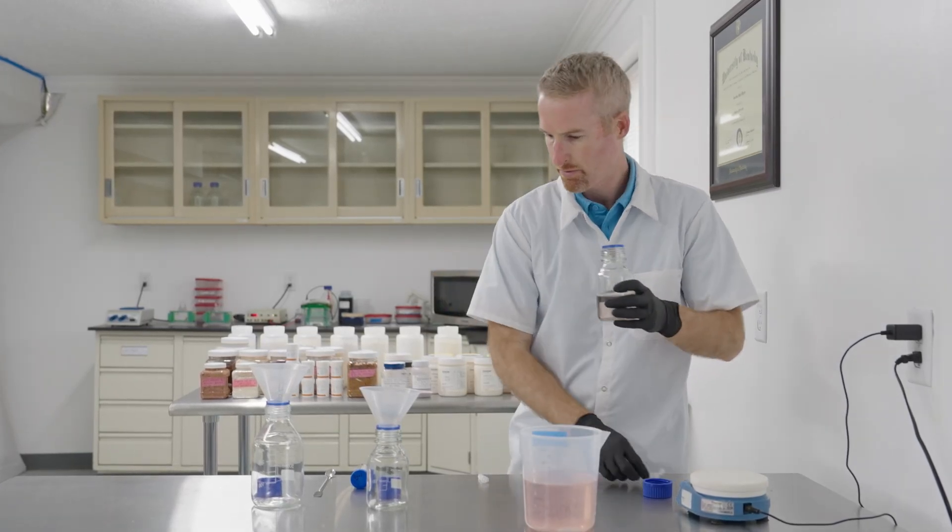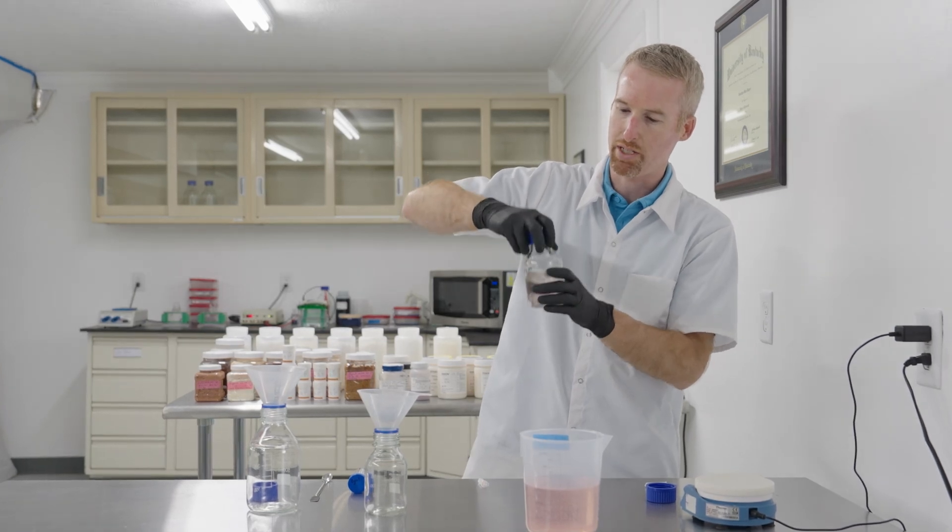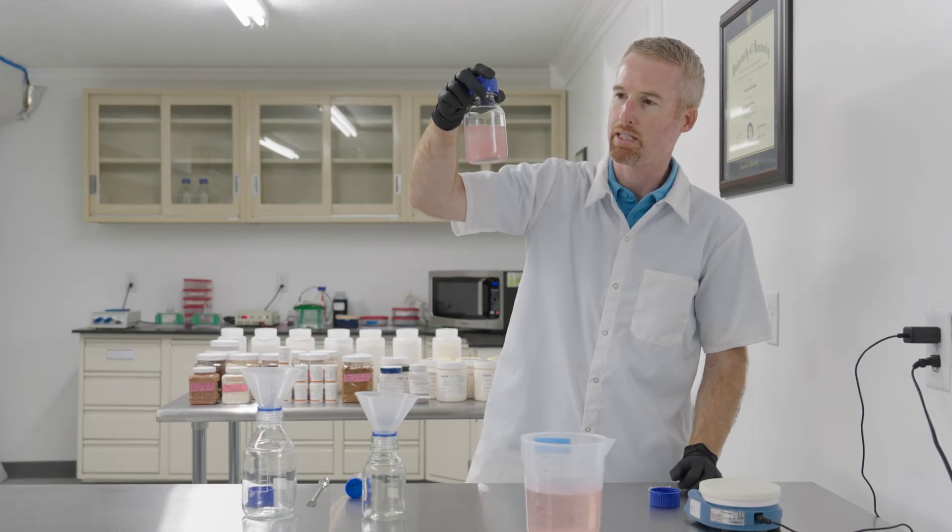You can see that it will turn pink as it breaks lactose down into glucose and galactose.